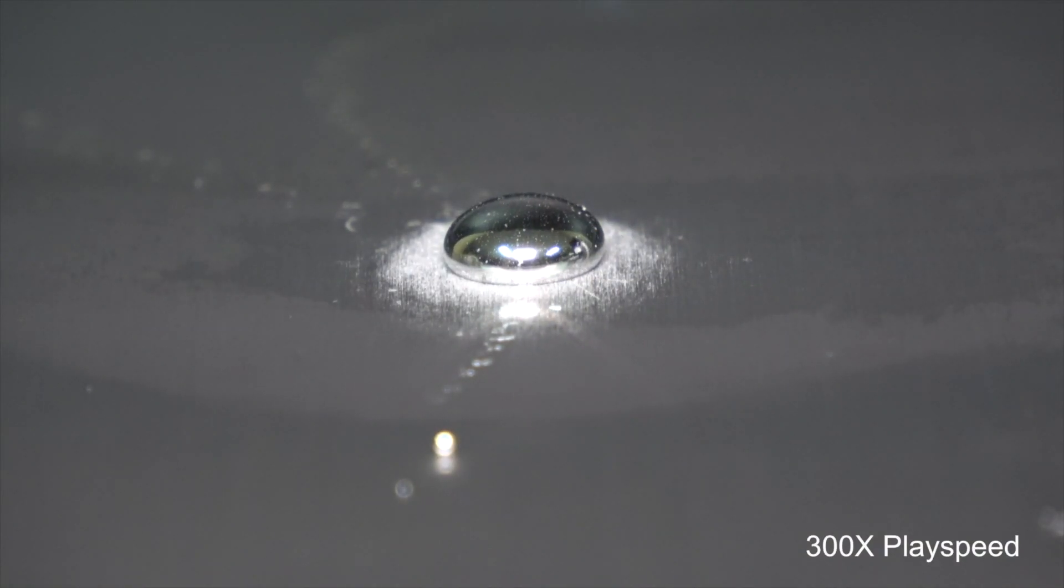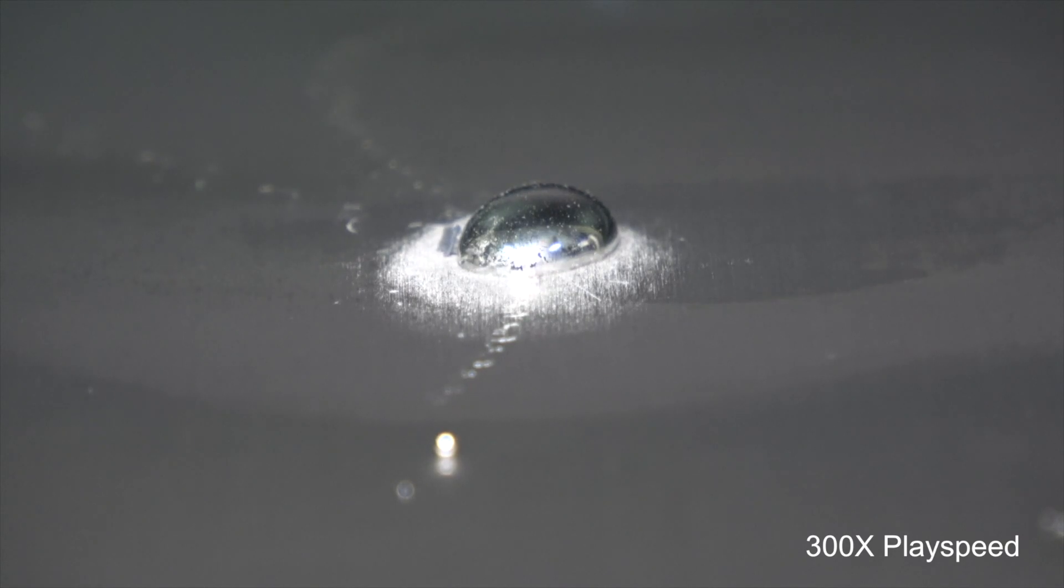And quickly applied a drop of mercury onto the plate before the oxide layer reforms on the surface. With the oxide layer gone, mercury can diffuse in between the grain boundaries of aluminum microcrystals, as well as forming an alloy with it.